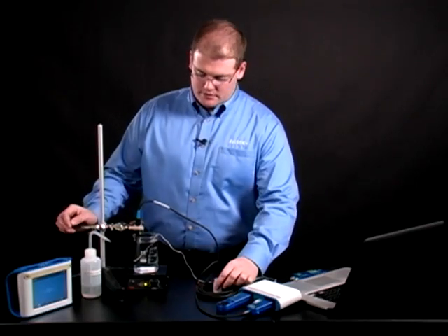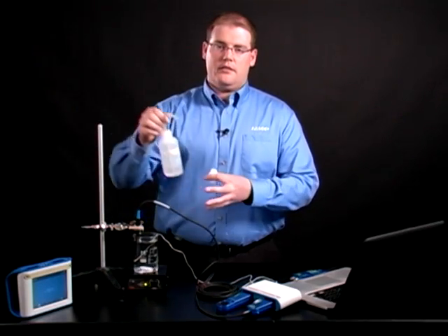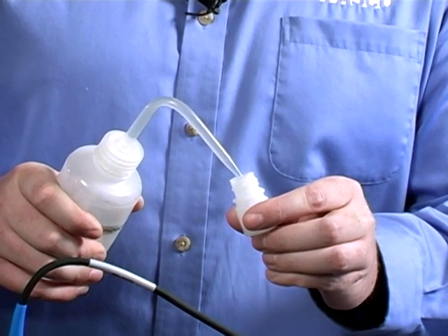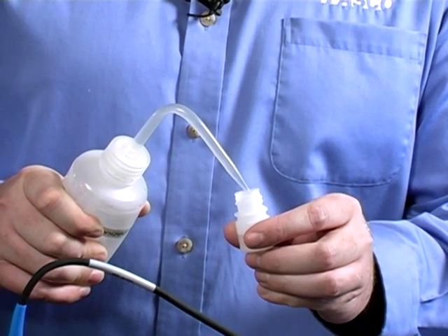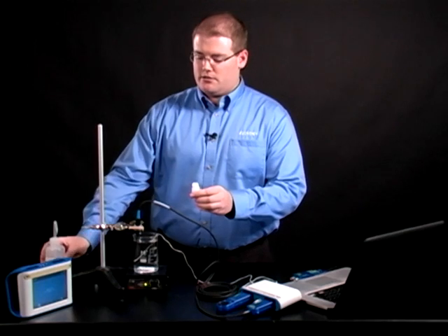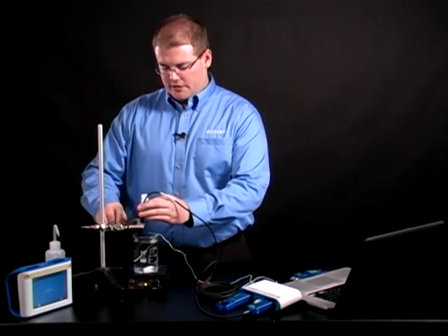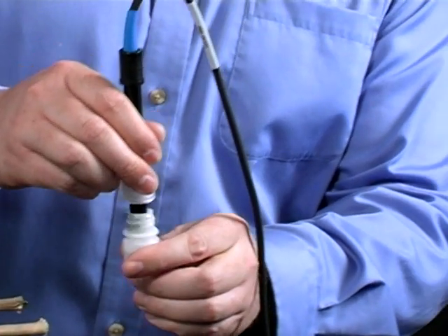Next, we need to add a small amount of distilled water into the sample bottle, about 5 milliliters. It's best to calibrate using distilled water, as dissolved solids can affect the solubility of oxygen. Place the probe into the storage bottle with the distilled water.